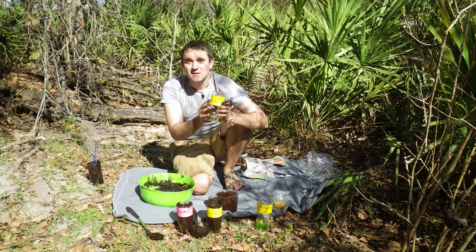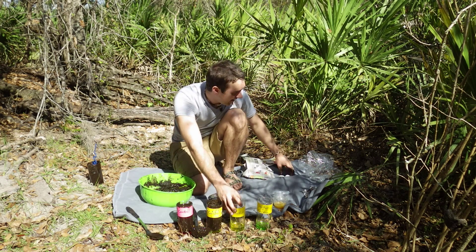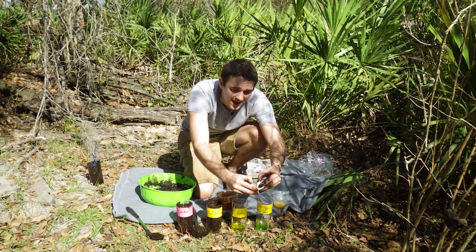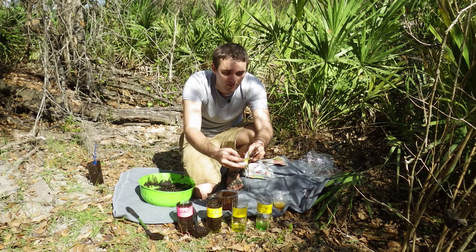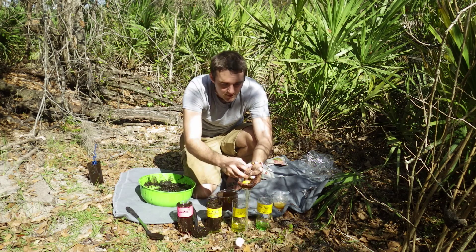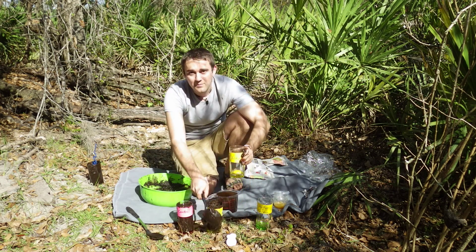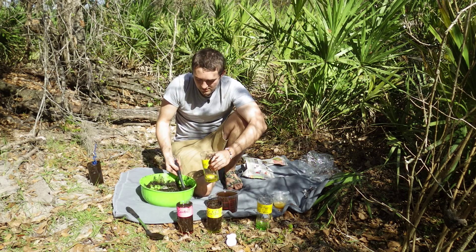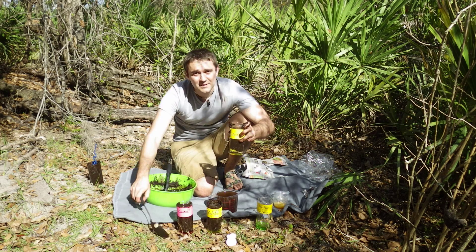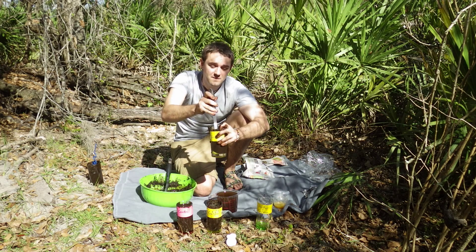The third column is with the sulfur. There's a very easy way to add sulfur to the mud and that's simply by adding an egg yolk. You crack the egg, separate out the yolk, and add it to the column. Here I have the yolk — I'm placing it in and then placing in the mud, and I'll simply mix these two ingredients together so that the column will grow the microbes that feed off of sulfur.